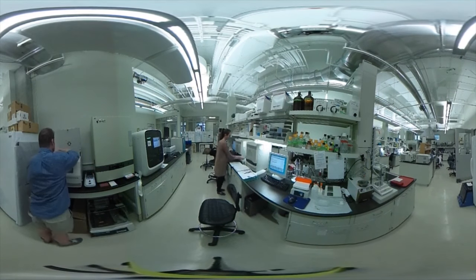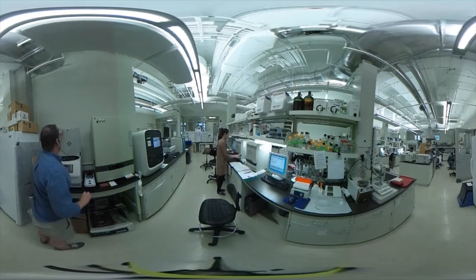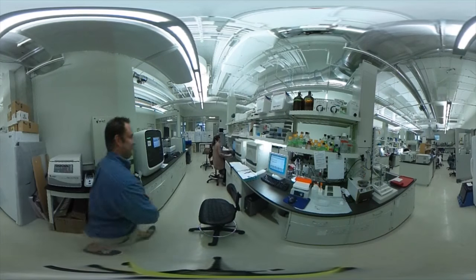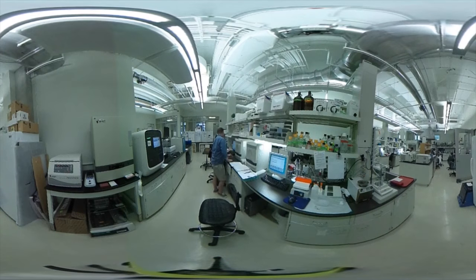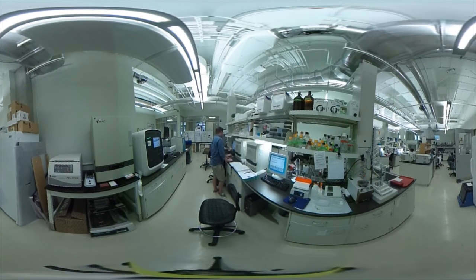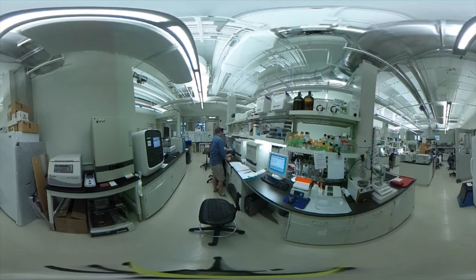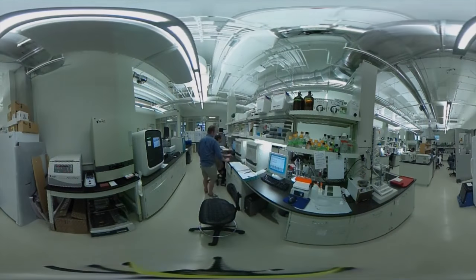The qPCR machine allows us to do all of that because it's quantitative. The more we can understand the system and see what the changes are, the better we can move into figuring out how to treat it. Once we understand all the different pieces of that puzzle, we can manipulate it — that's where these tools play an integral role in the science behind treating pine beetle or the associated fungus, and right now we're still working toward understanding the key factor.